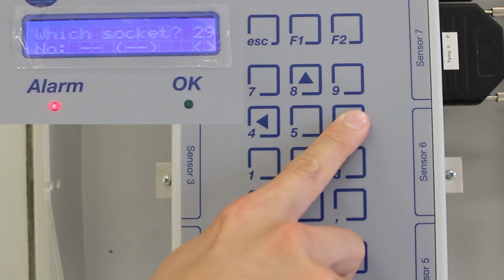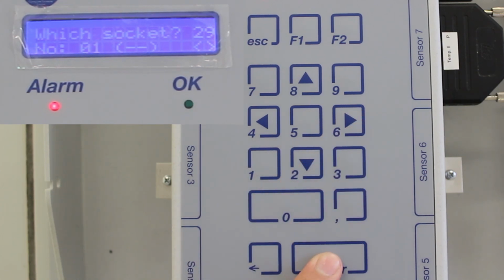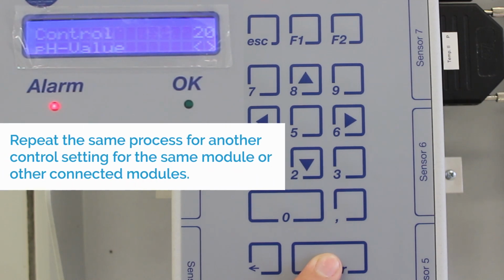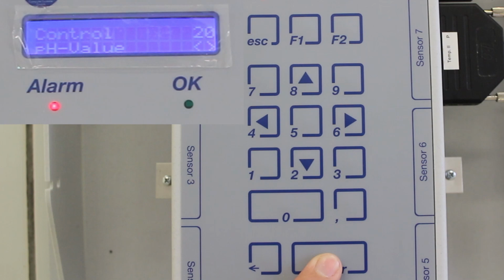Now, allocate the function to the socket where you plugged the power supply of the solenoid valve. For example, you've plugged the solenoid valve to socket number 1, and the following will show on the display. Select this socket. Sockets with no control settings yet have the following shown beside the number. Lastly, confirm by pressing Enter. You can now allocate different control settings to other sockets using the same pH module or a different module connected to IKS Aquastar. Once everything is set, go back to the main menu level and select Run.